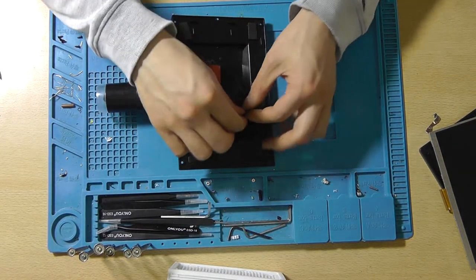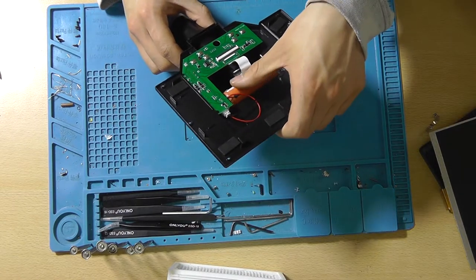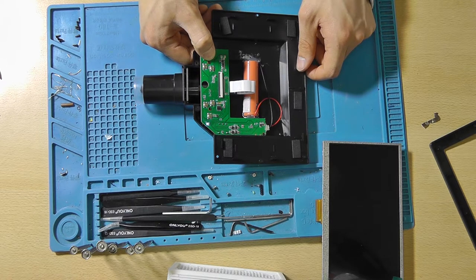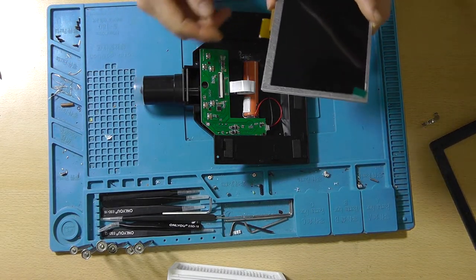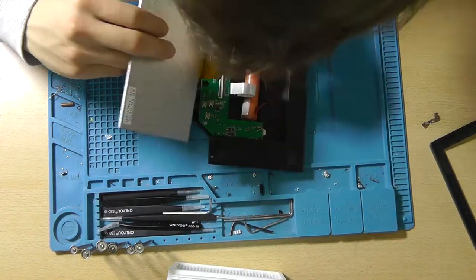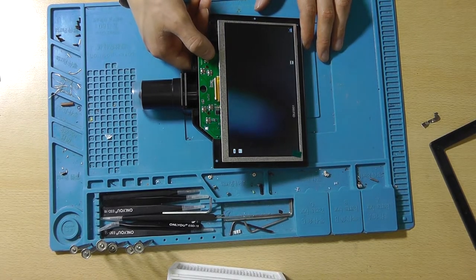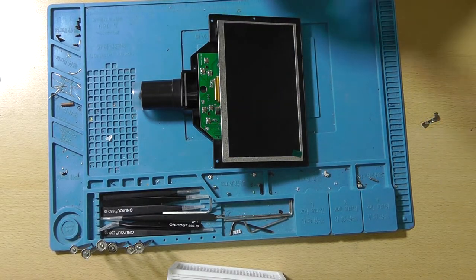And now we should be able to connect the battery. The wire is a little bit on the short side, but it still manages to connect. If we press the power button, we should see it turn on, which it does. And it also turns off. So that's rather nice. Now let's reinstall the screen. So the screen is installed. Let's see if it works. It does. So that's very good news.